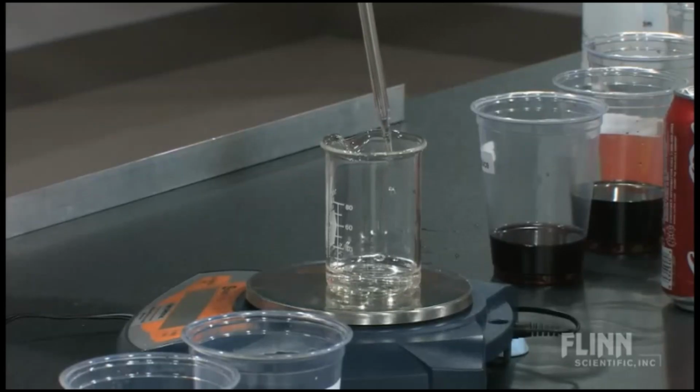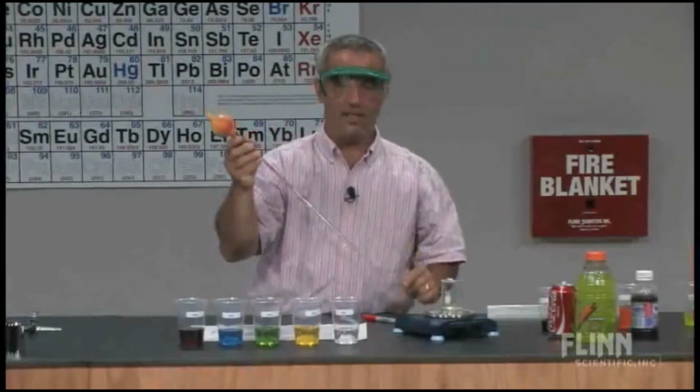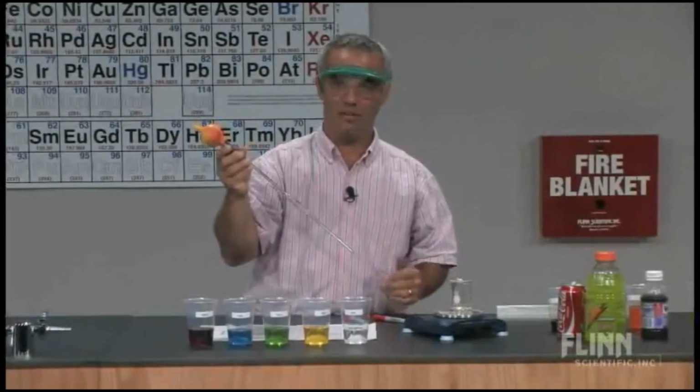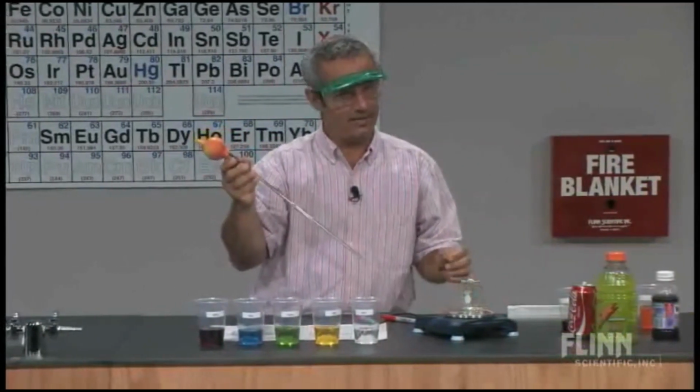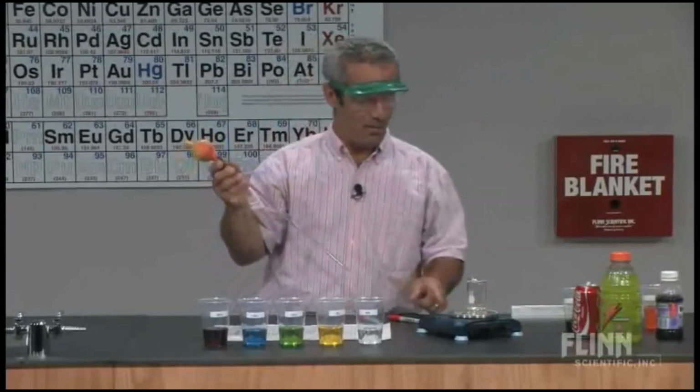Right, I'm going to let this drain out first here. And then the technique is to actually touch the last drop to it. And this little bit that's left in there is meant to be left in there. And that 10 milliliters of water, you're thinking 10 grams, but not quite. It's 9.98. We'll have that recorded over here on the board.